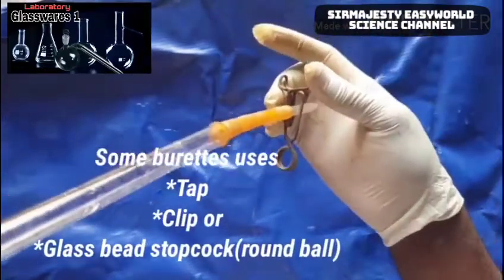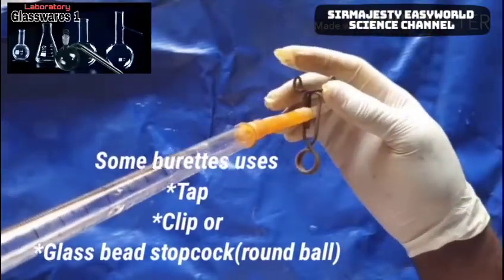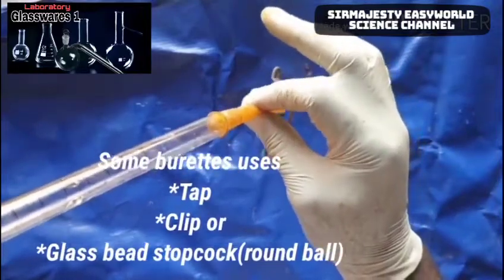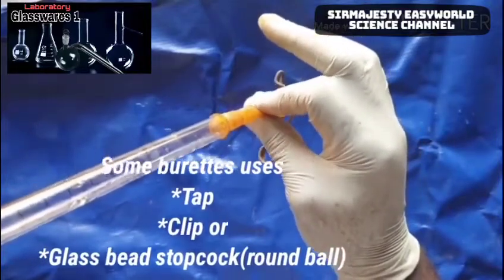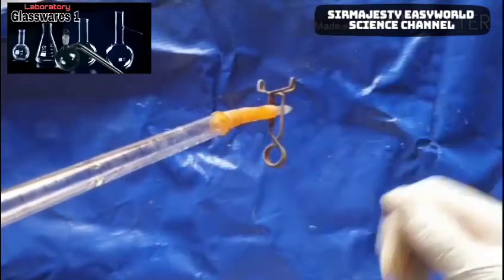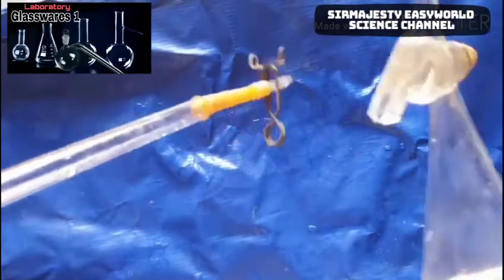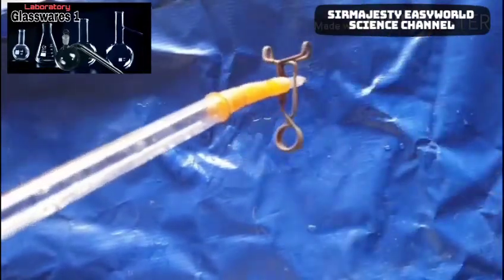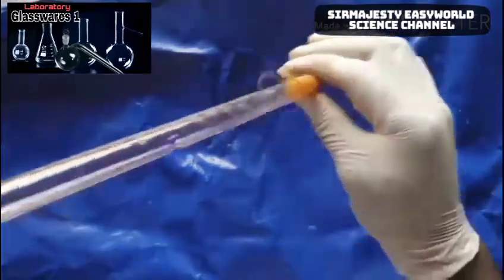The burette usually has a tap. This one uses a clip, but some have a glass tap, some use a ball inside — if you press it the liquid goes out. Others use an open tap. This one has just the clip. It is used for titration. Another piece of glassware used for titration is the pipette.